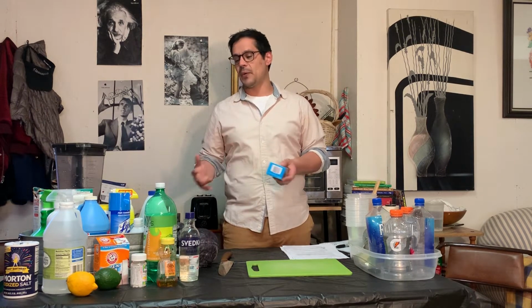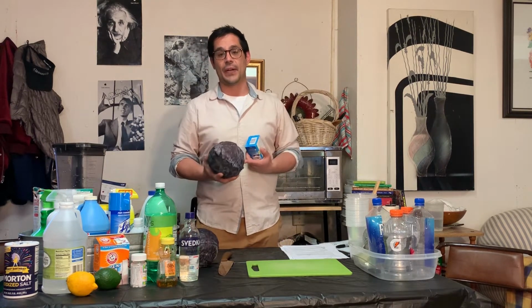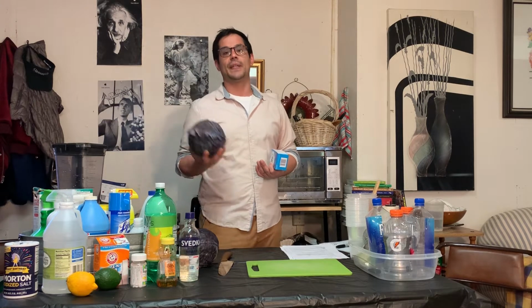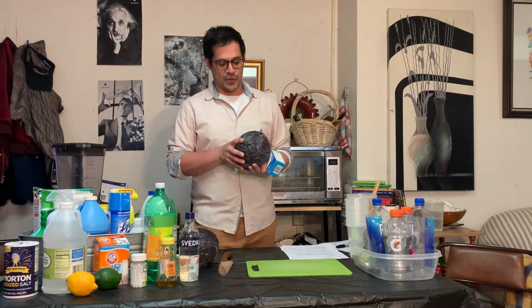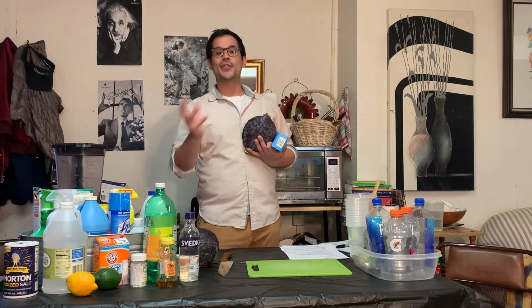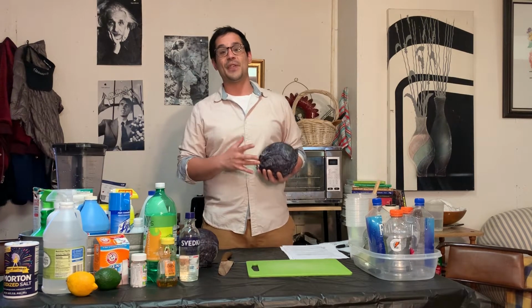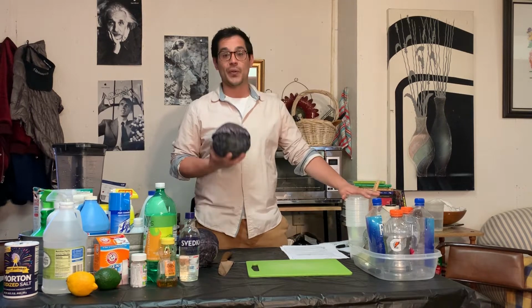So we're going to be looking at just how the presence of a compound, which is our red cabbage indicator, specifically an anthocyanin, behaves. This is a plant-based pigment that yields the colors that you see. For the red cabbage indicator, the anthocyanins show a very dark red-purple color. It just so happens that this compound also changes in the presence of the environment that it's in. So if it's in an acidic environment, it'll turn red. If it's in a basic environment, it'll turn blue. And the normal color at pH neutral 7, you'll see is purple.